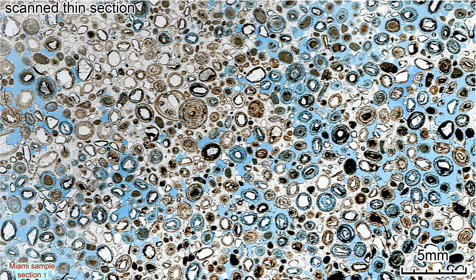The preservation of ooids in the first thin section is highly variable. Some still retain aragonite layers that alternate with concentric sheet pores. Some have their cortices replaced by mosaics of irregular-shaped calcite crystals, and some are oomoles containing no aragonite but concentric shells of brown material.